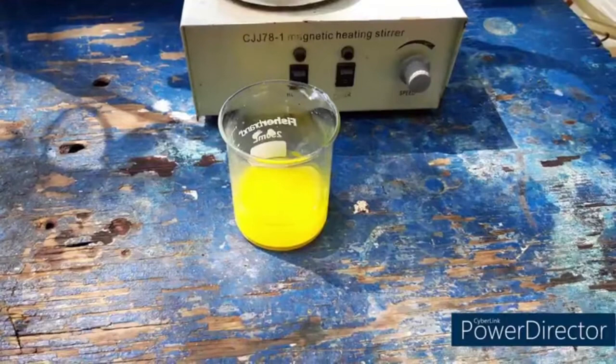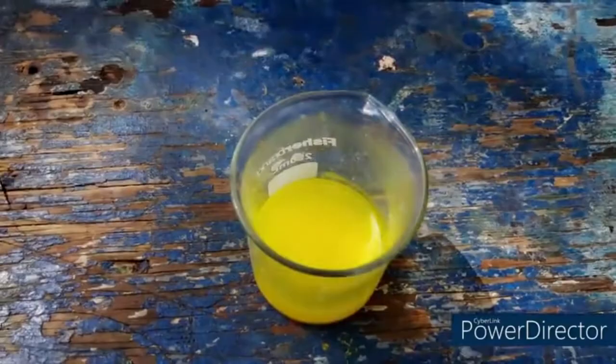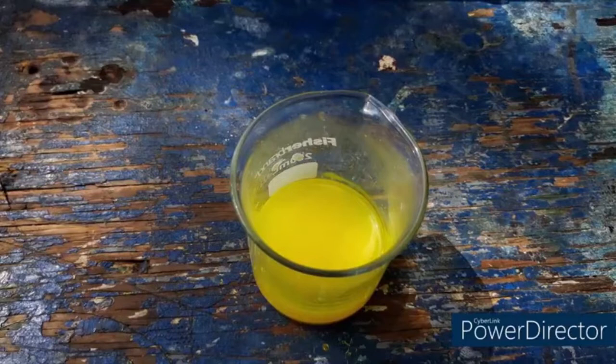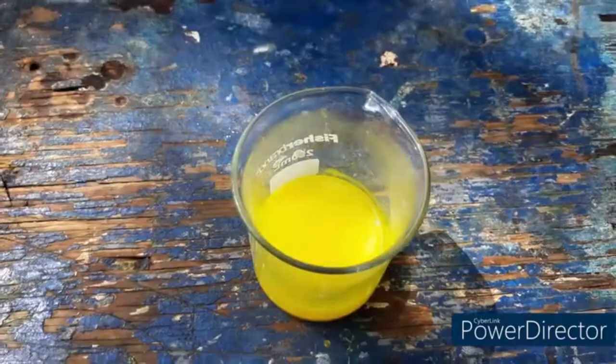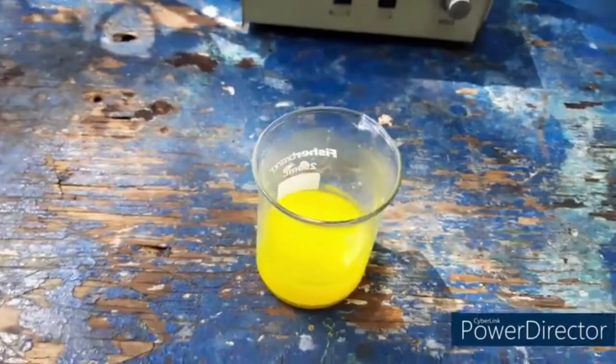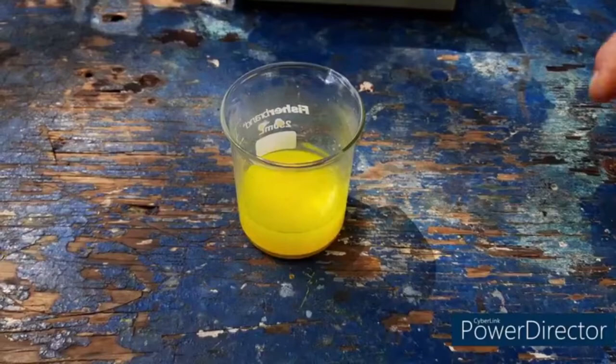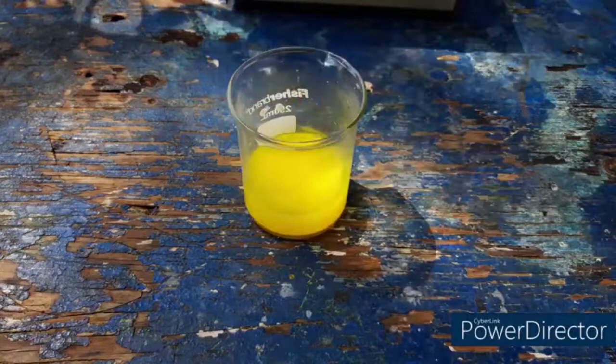Holy fucking shit people, look at that man, it worked. It actually worked. And it's doing exactly like the textbook said. It said that as it cooled down, more of it would crystallize out. Oh my God, everything went perfectly. This is exactly like the textbook said it would be. Camera, really? I have been working on this for days. Don't you dare fuck up my triumph. Look at it man, it's fucking glorious. I have taken on and defeated yellow chem once again, and I didn't do it alone. Much thanks to everybody who gave me some feedback on this.